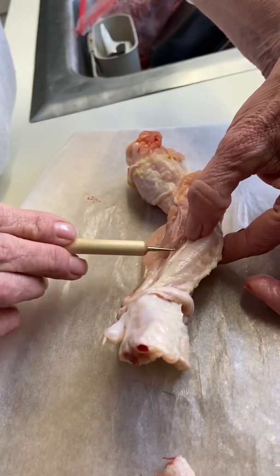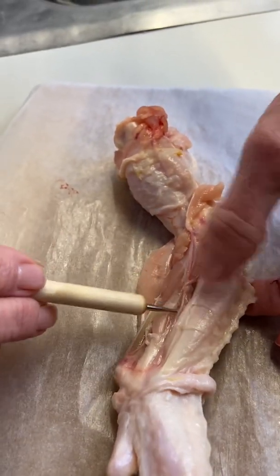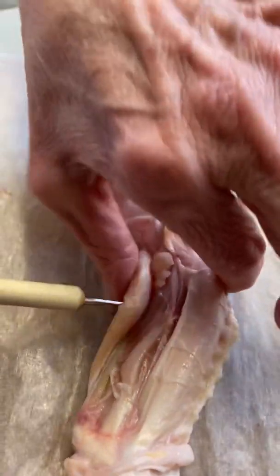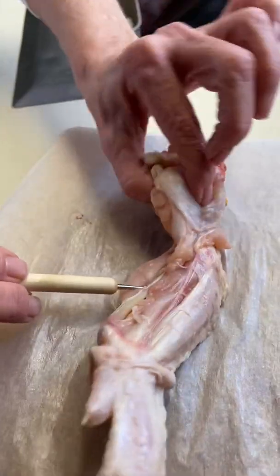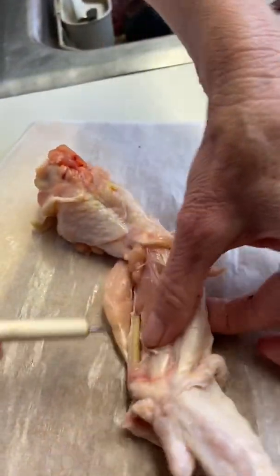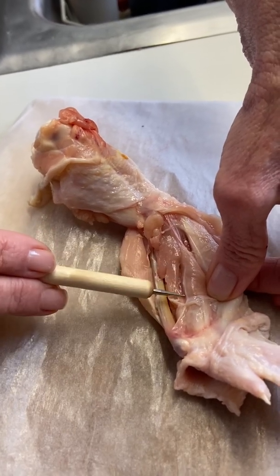Hang on, it's usually running very close. You can actually see, no, that's not it. Hang on a second. Sometimes I've got a little bit of film on here, but it's a little white. Oh, there's a little nerve running in there. There you see, very fine, very thread-like. And let's see if I can see anything better over here. This is kind of drying out once you get it exposed to air, this raw chicken. But that may be my best. Could be a nerve running right in here as well.